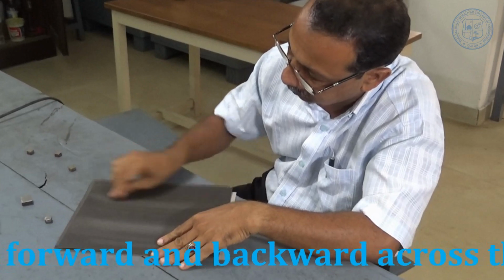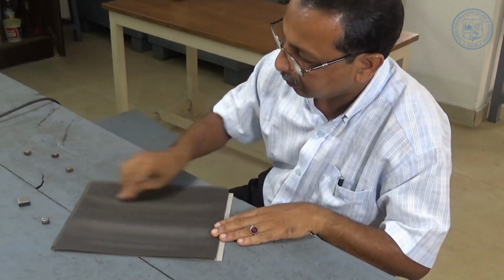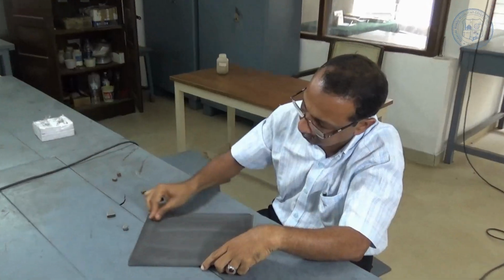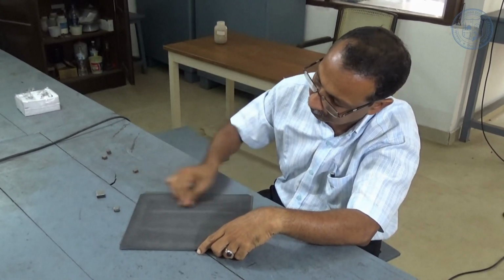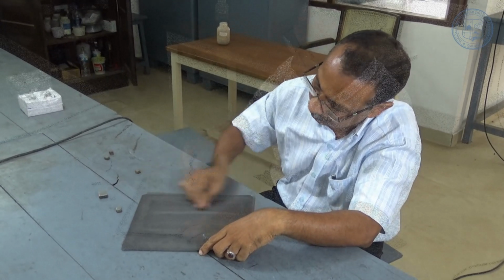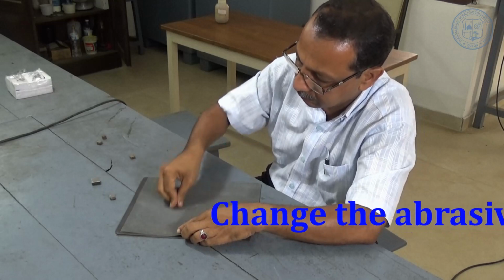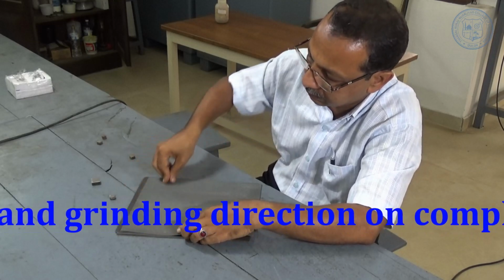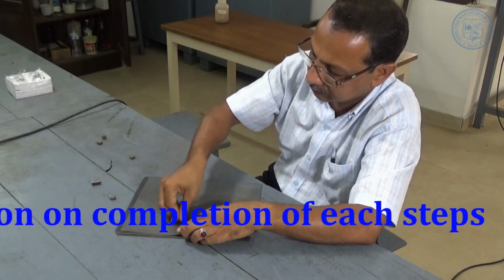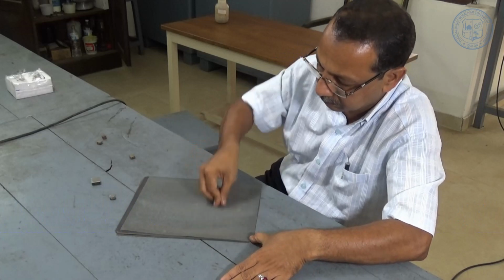Start with a coarse grit of 100 and using a firm and uniform pressure, slowly move the specimen forward and back across the abrasive. This will produce parallel scratches of uniform size. Continue this step until the entire surface of the specimen is flat and contains only scratches of the size of 100 grit abrasive.